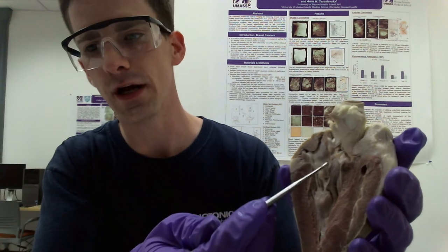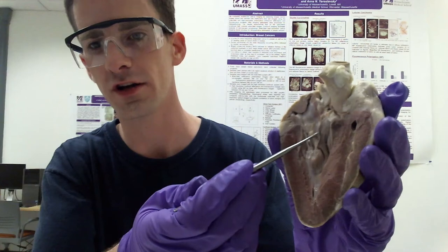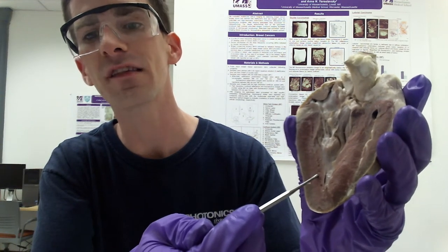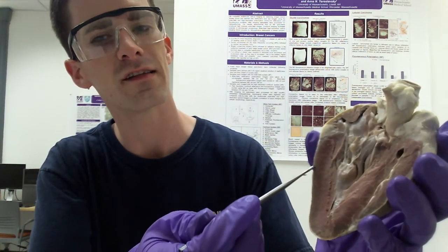And if we look once again on the inside, we can appreciate the various layers lining the heart. So the innermost layer is the endocardium, which is a thin membrane lining the inside chambers of the heart, and you can see that here. Whereas the myocardium is a much thicker section of cardiac muscle in the heart wall that contains the cardiomyocytes themselves. And all the way on the outside is the epicardium, which is a serous membrane forming the outer surface of the heart.